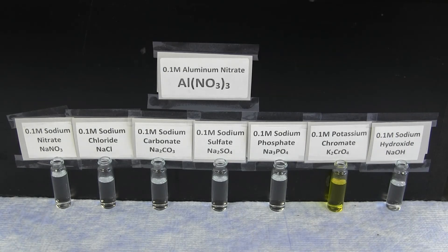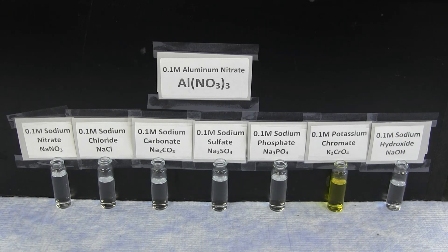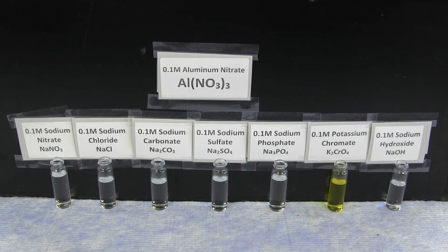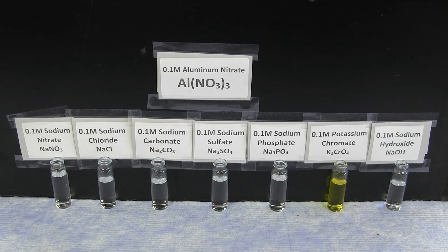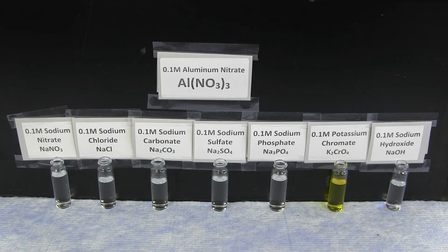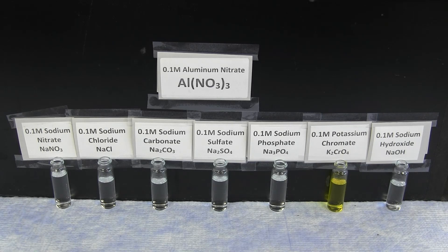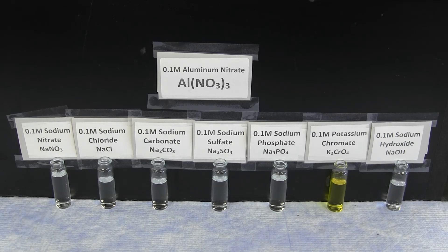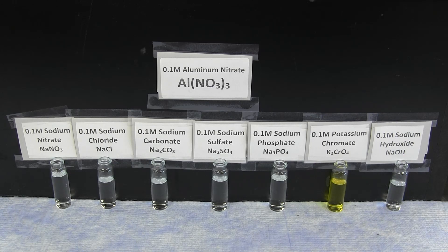This video experiment is a qualitative experiment that looks at the reactivity and solubility of different metal ions. Different metal ion solutions will be reacted with sodium nitrate, sodium chloride, sodium carbonate, sodium sulfate, sodium phosphate, potassium chromate, and sodium hydroxide solutions. By seeing the reaction patterns and determining how many times each different metal ion reacts, you can get a sense of which ions are more reactive and which are more soluble, based on their location within the periodic table.